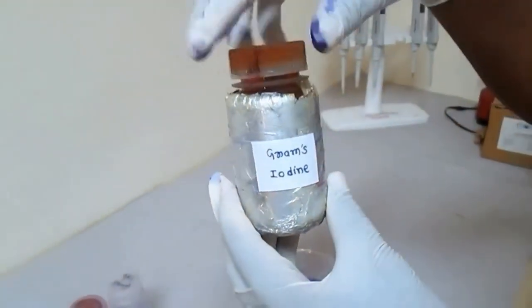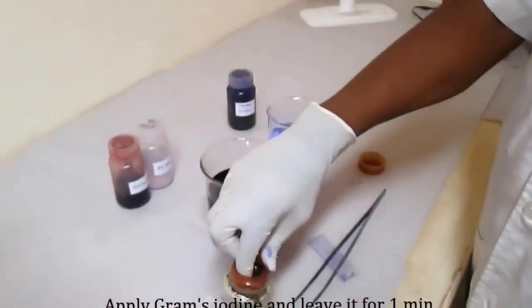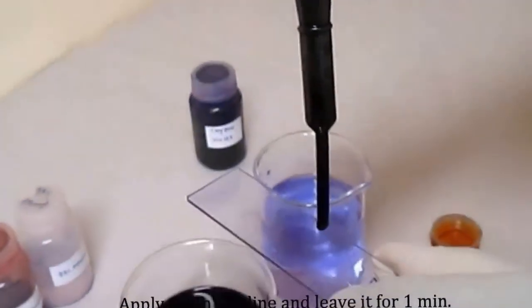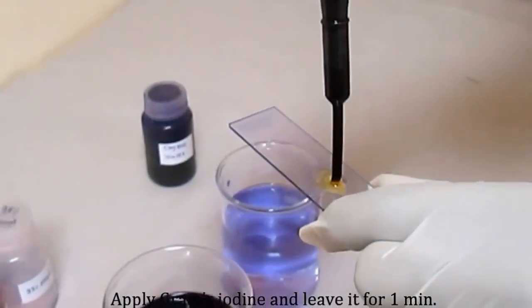Gram's iodine. It acts as a mordant. It reacts with crystal violet to form a complex. Apply this Gram's iodine on the smear and leave it for 1 minute.